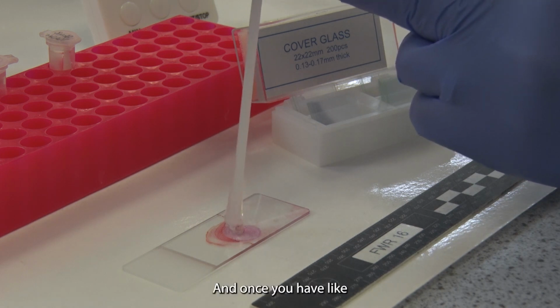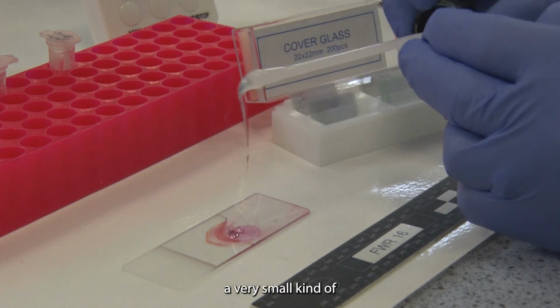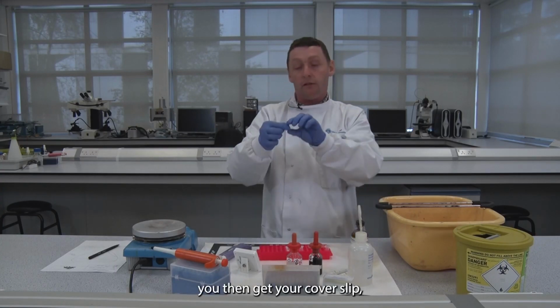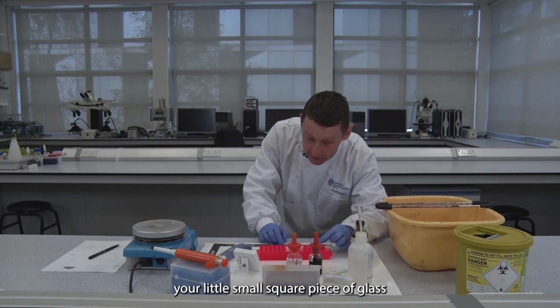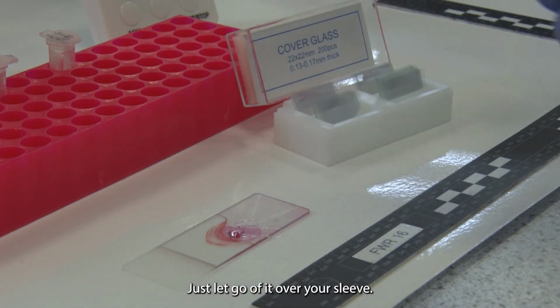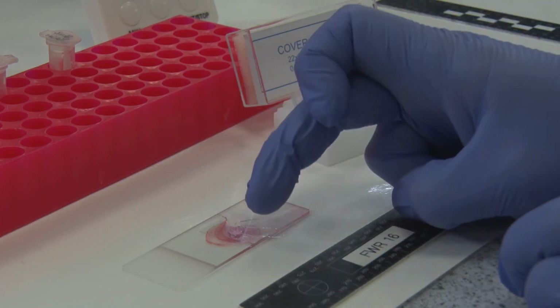And once you have a very small blob of it, you then get your cover slip, your small square piece of glass, and at a 45-degree angle just let go of it over your solution and let it nicely fall on top of your sample.